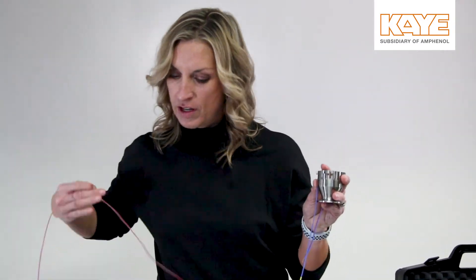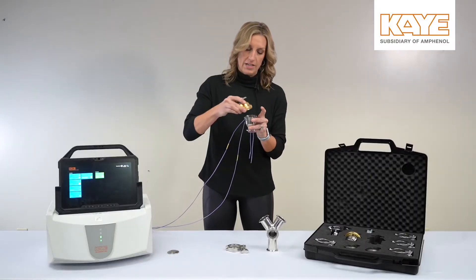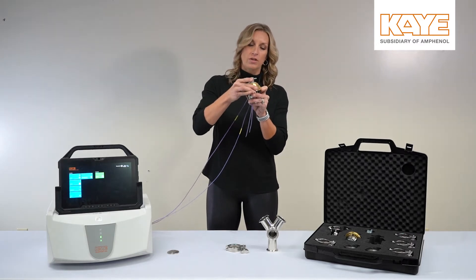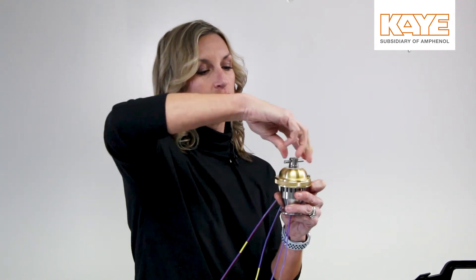Then you could place another one and keep going until you have what you need. Then you'll take the other gasket, place that over, take the lid — there's a little lock connection up here — you'll turn it and then twist down.